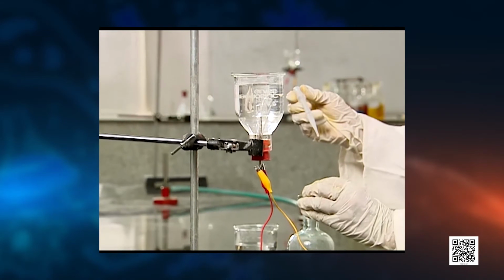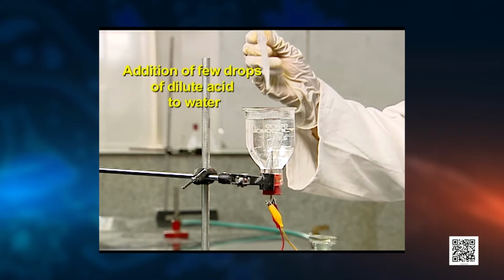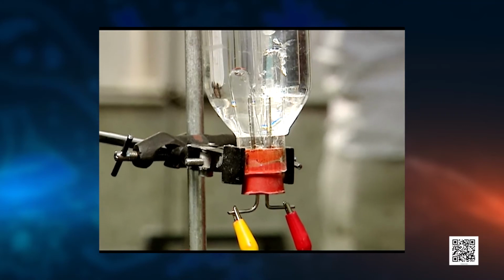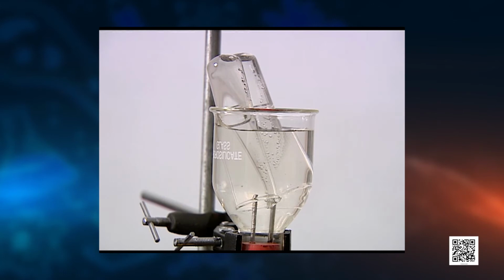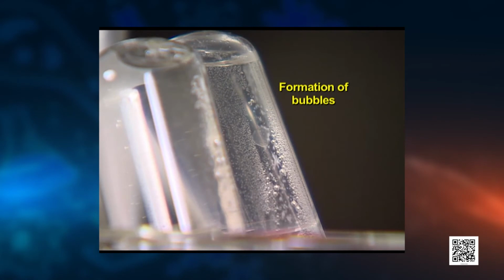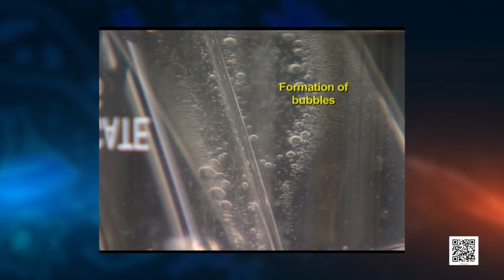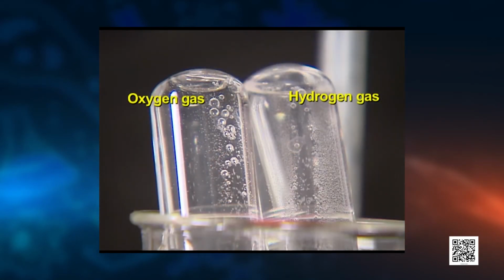Now look at the video carefully. See, the reaction will become fast here. Slowly, the gases will collect in these. What do you see? Formation of bubbles taking place at both the electrodes. Is the volume of gas collected the same in both the test tubes? In one, you see more gas, but in the other there is little gas, because the ratio of the gases is different, that is 2:1. See here, you can see effervescence. Do you know why? Now we will test.